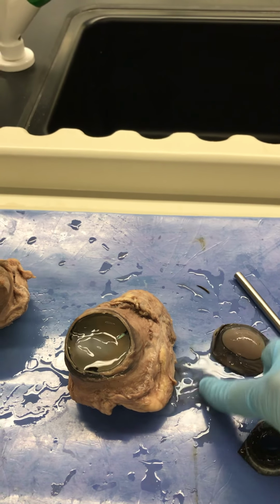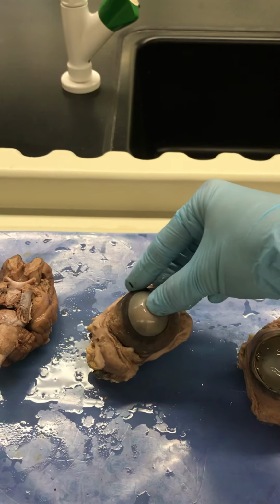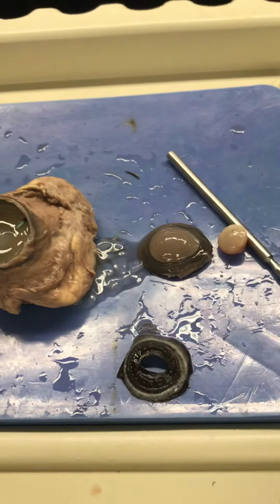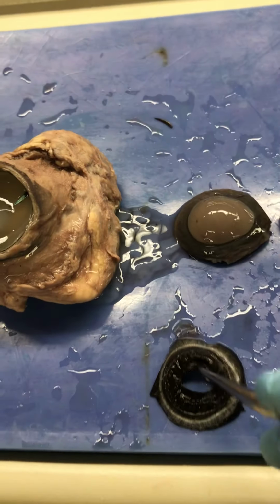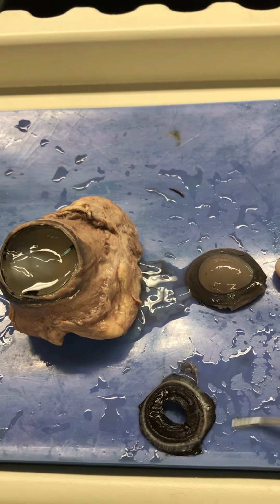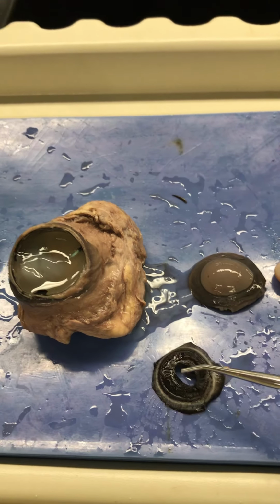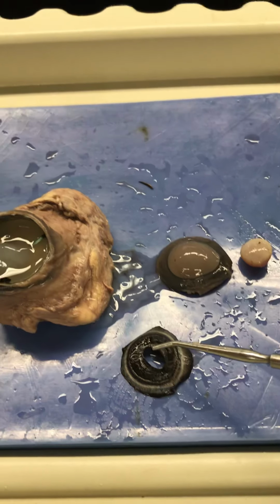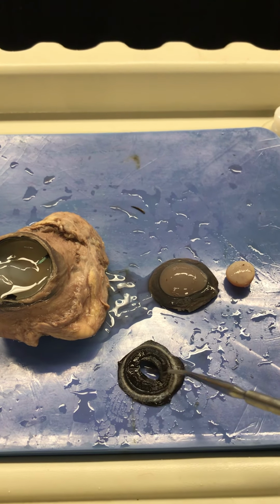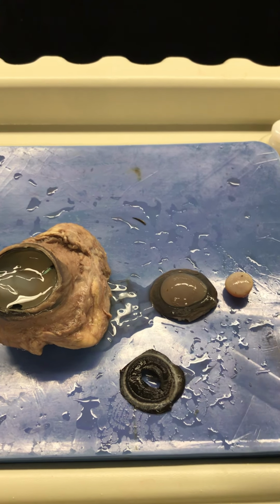You've seen I've lost some of that aqueous humor there, that water that gave us pressure. It's now right here. And this is the pupil. So the pupil is the hole, okay? And it is what lets light into the eye, so it dilates and constricts to let more or less light in, respectively. And then this dark colored structure around it is actually a couple of muscles, and those are called the iris.